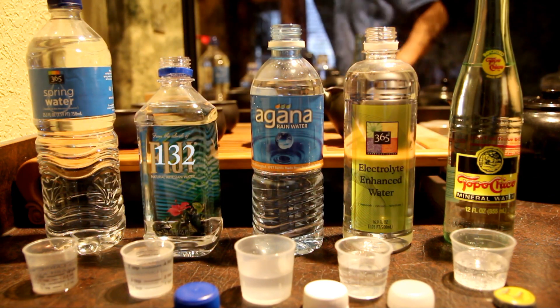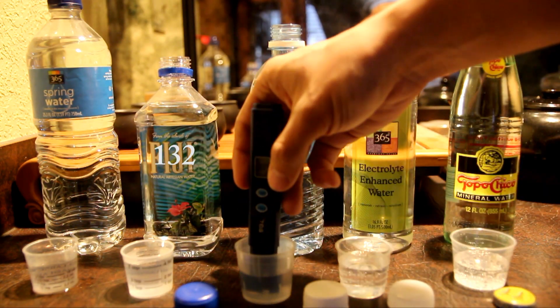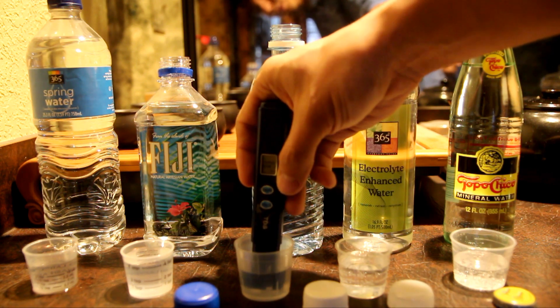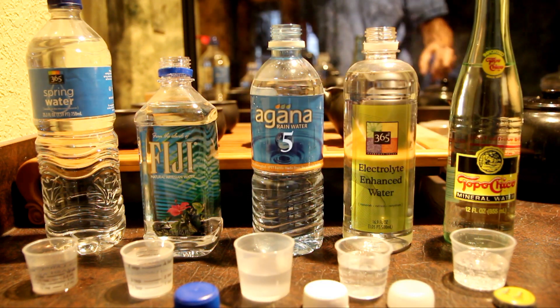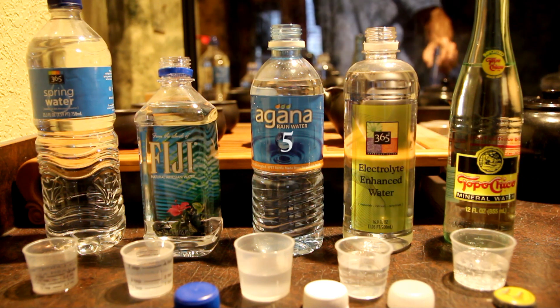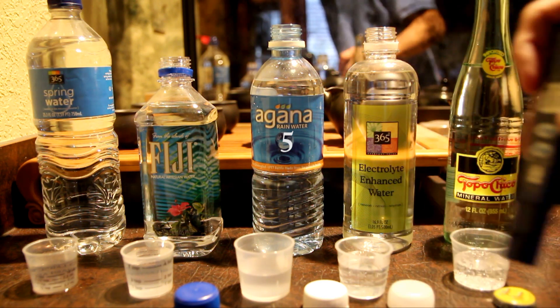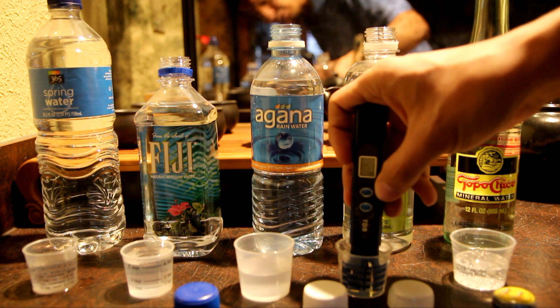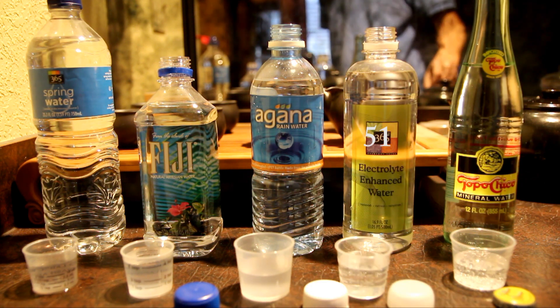Rain water is 5, so rain water is just like dead water — had no idea. Electrolyte enhanced water is 51. Interesting.